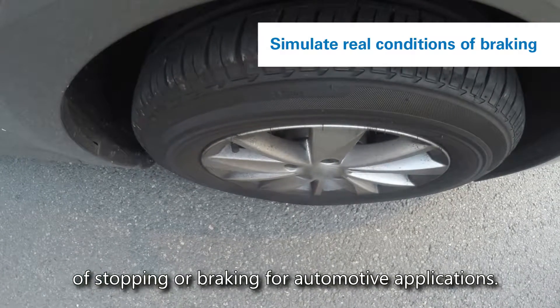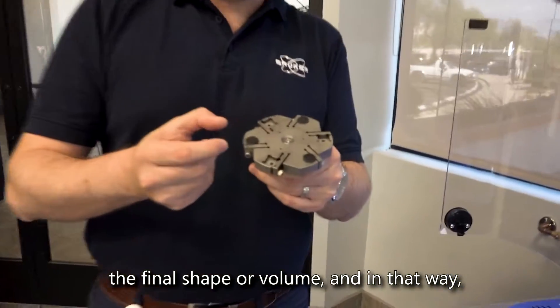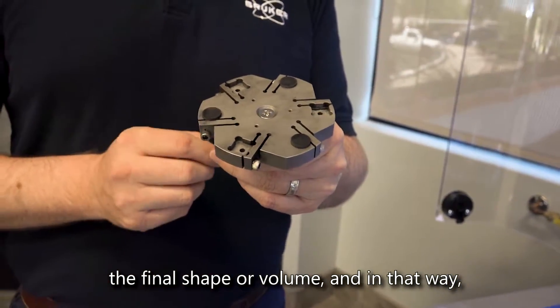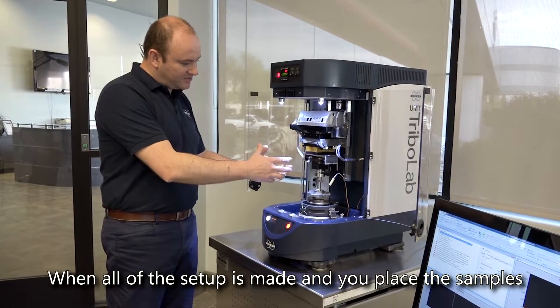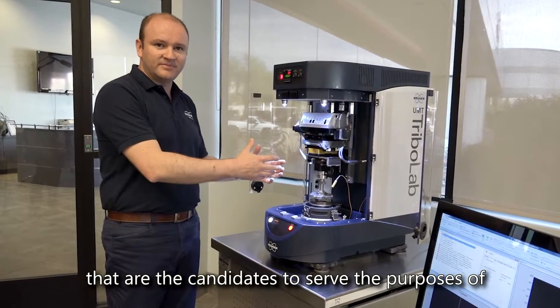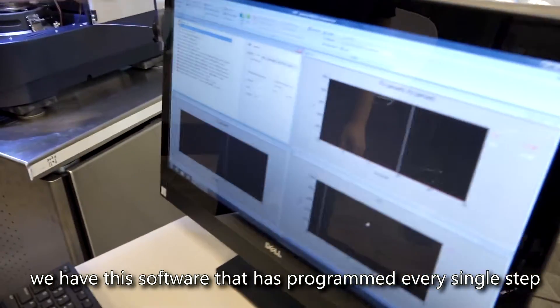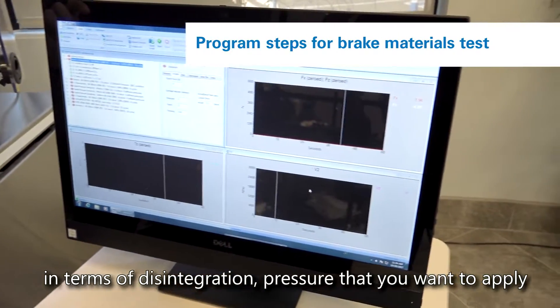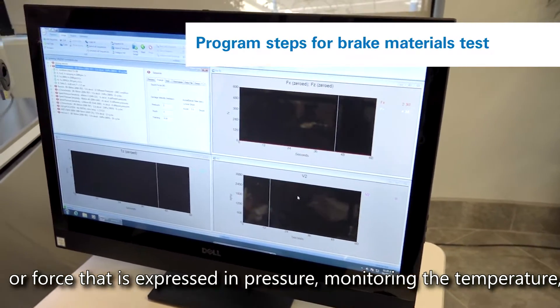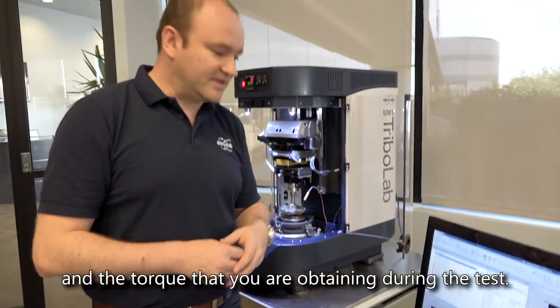We are able to simulate real conditions of stopping or braking for automotive applications. We manufacture these small pads without the need to go to the final shape or volume, and in that way we can speed up the development cycle. When all the setup is made and you place the samples that are candidates to serve the purposes of a brake material, we have software that has programmed every single step in terms of deceleration, pressure or force, and it monitors the temperature and the torque obtained during the test.